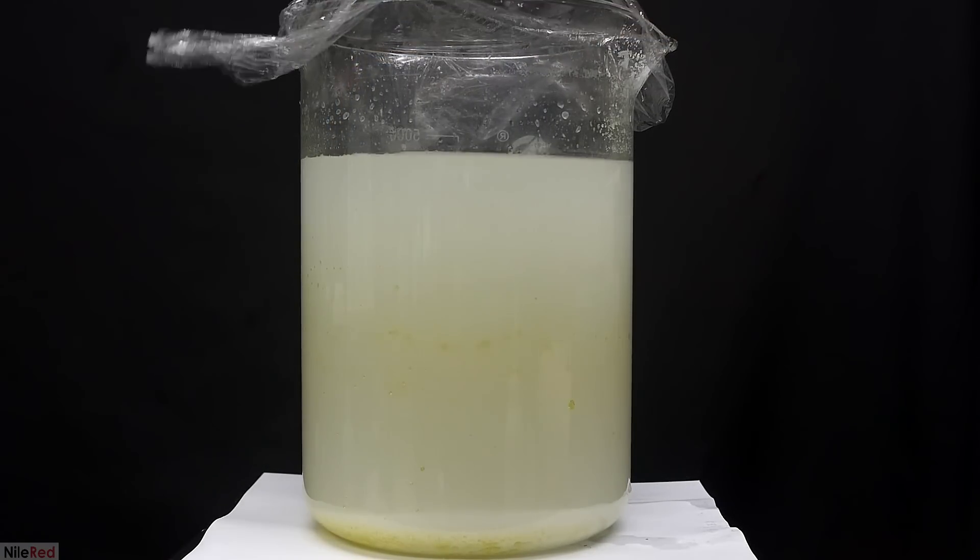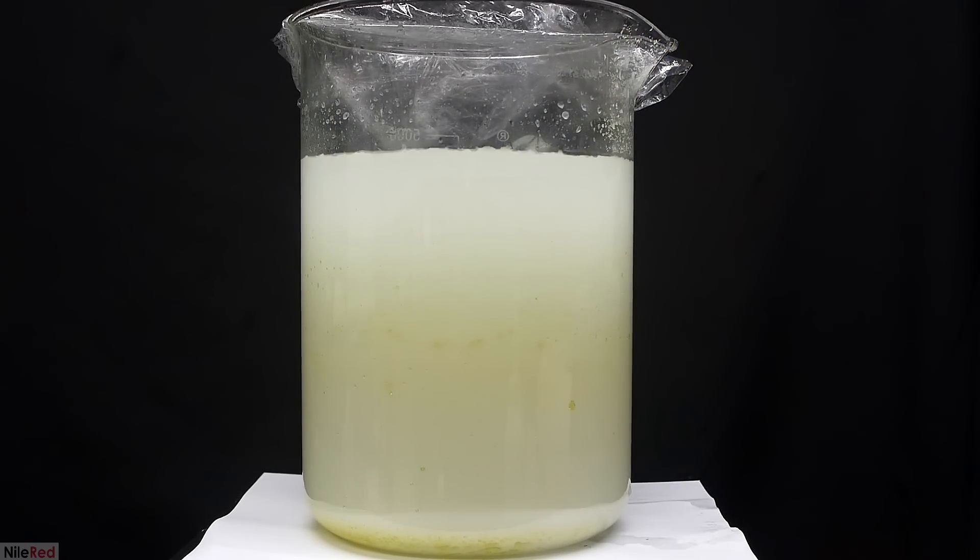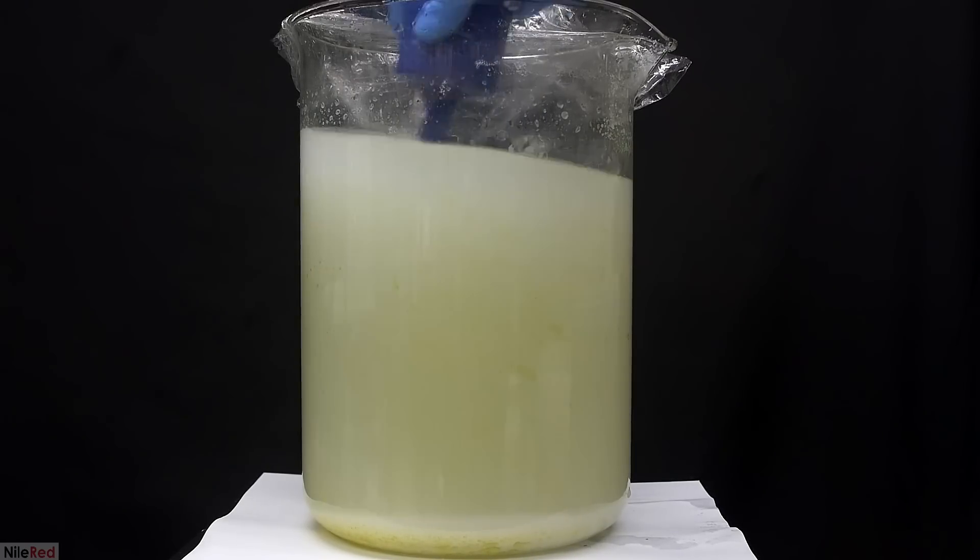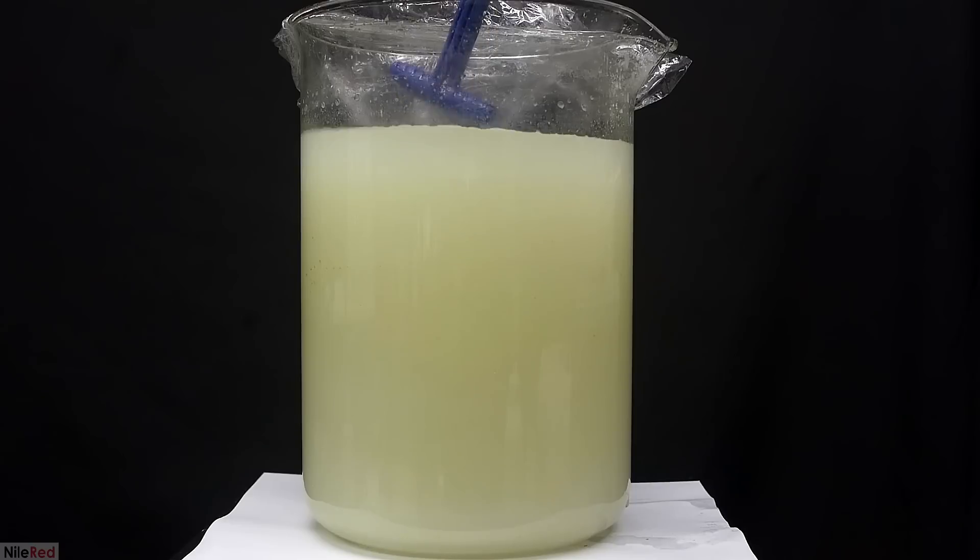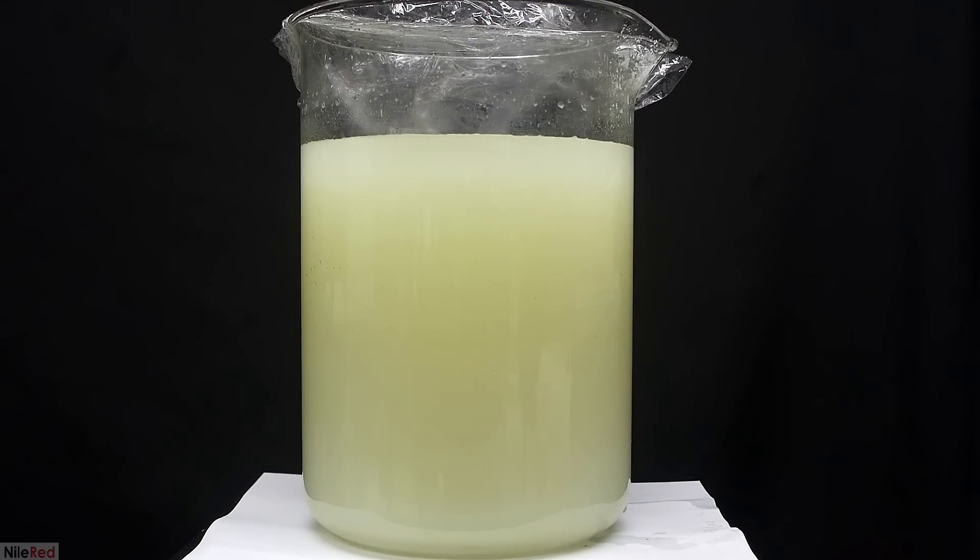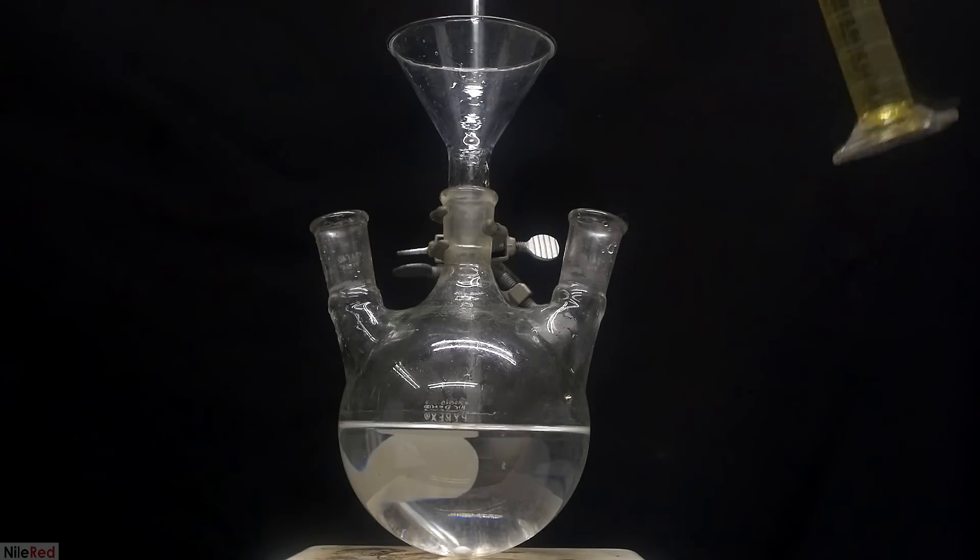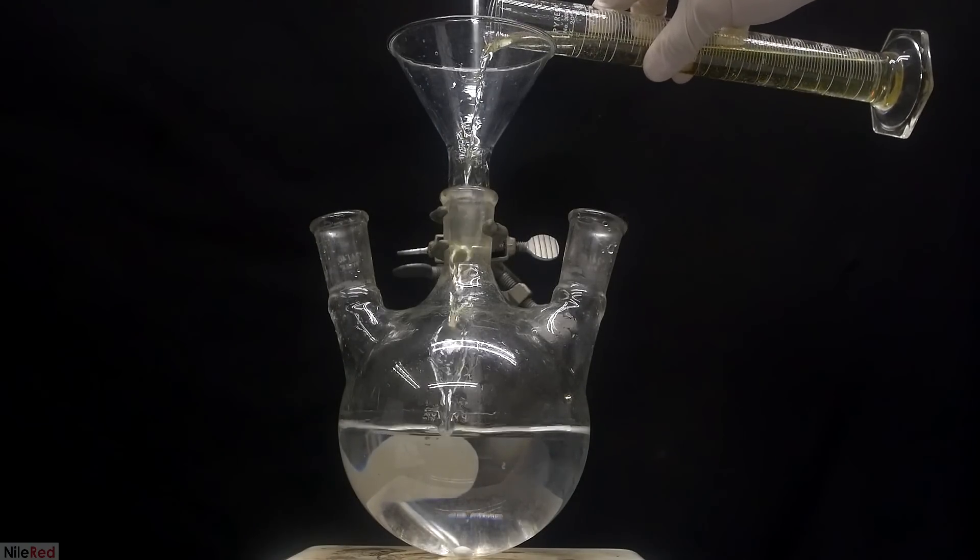Today we're going to be making benzaldehyde starting from cinnamaldehyde. The cinnamaldehyde that we're starting with smells like cinnamon and the benzaldehyde that we're ending with smells like almonds or cherry candy. I think that the distinct change in smell from the beginning to the end is pretty cool.